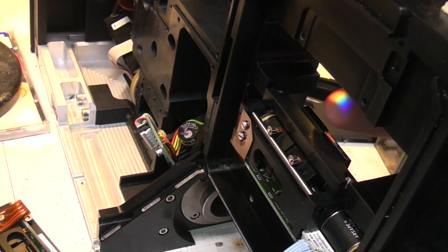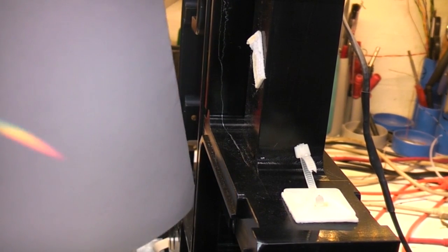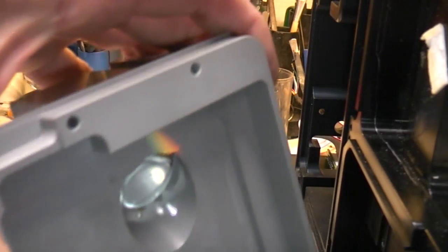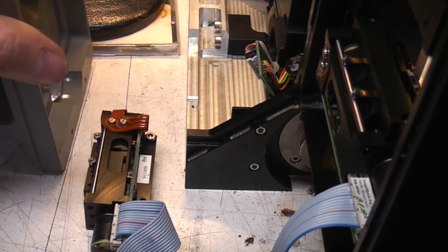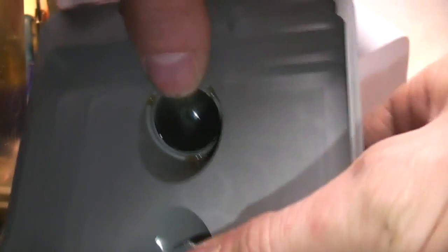So the light comes down here and it hits these 2 mirrors, which are adjustable for position, and basically what that does is deflect one end of the spectrum up this way, so we've got sort of red to green here, and that goes into this top detector. The part that goes to the centre goes down this gap and into this bottom detector on this side, and the other mirror reflects up in this direction, so into this detector here. Now this bottom sensor must have been the one that wasn't fitted, because no light goes in that direction.